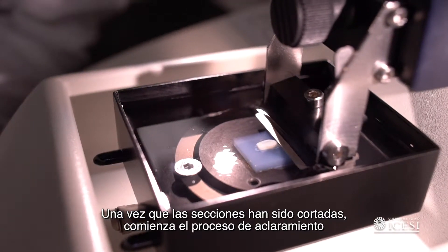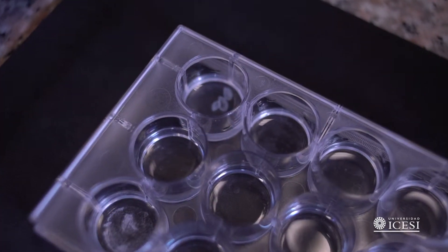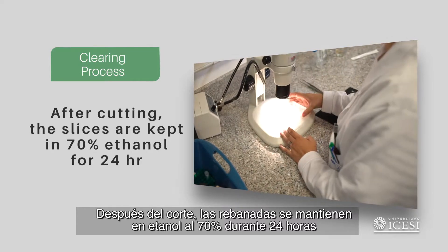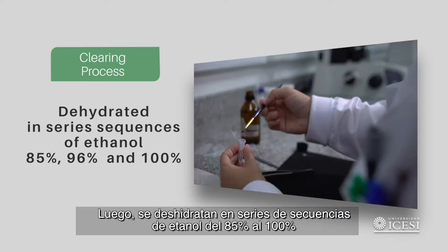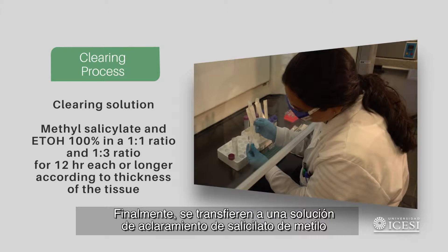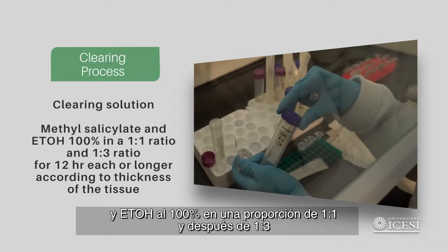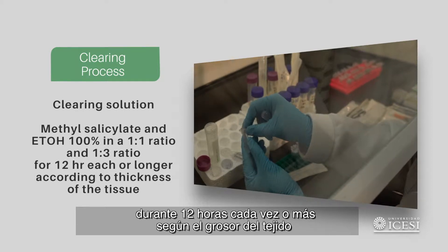Once the sections have been cut, the clearing process begins. After cutting, the slices are kept in 70% ethanol for 24 hours, then dehydrated in series sequences of ethanol from 85% to 100%. Finally, they are transferred to a clearing solution of methyl salicylate and ethanol 100%, in a 1:1 ratio and 1:3 ratio, for 12 hours each or longer, according to the thickness of the tissue.